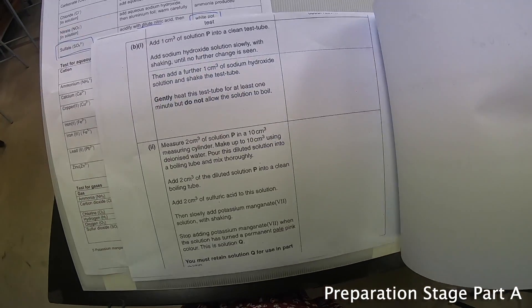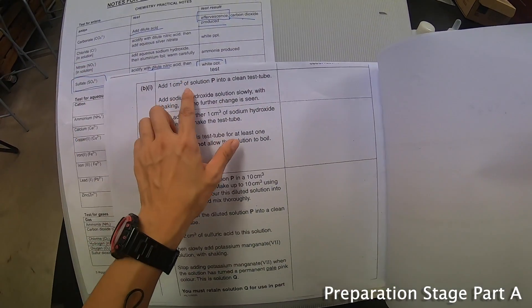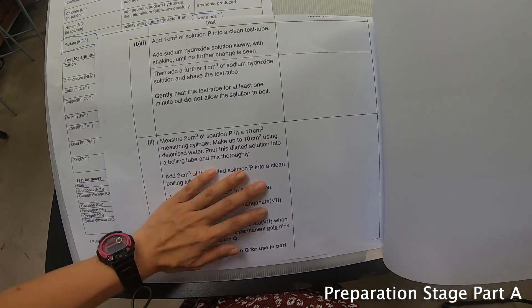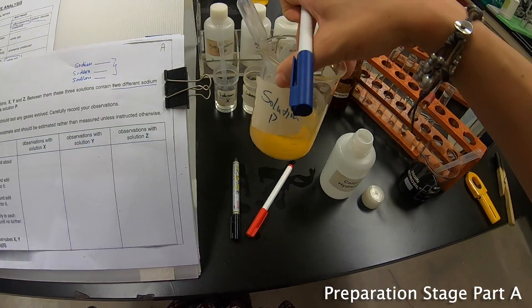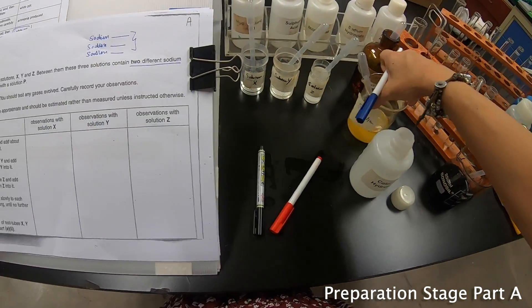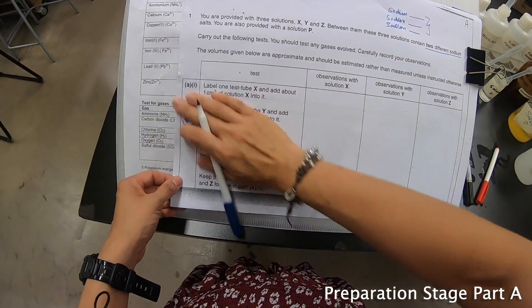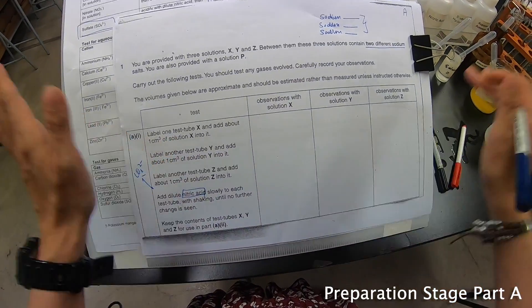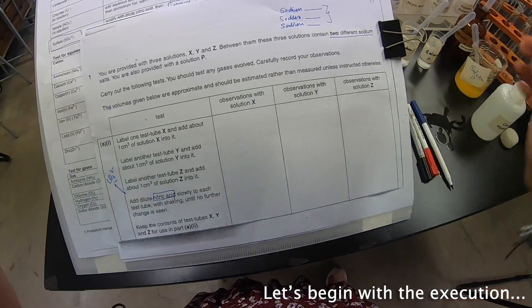Part B, part 1 is completely for solution P, which is entirely different. So what I will do is complete all of Part A first and then Part B together. Since I've already prepared everything, let's start the execution.